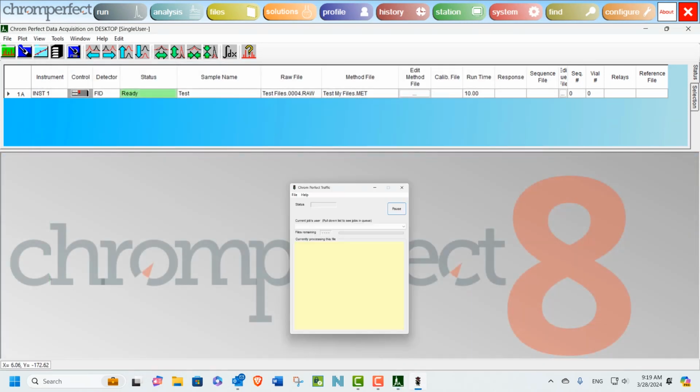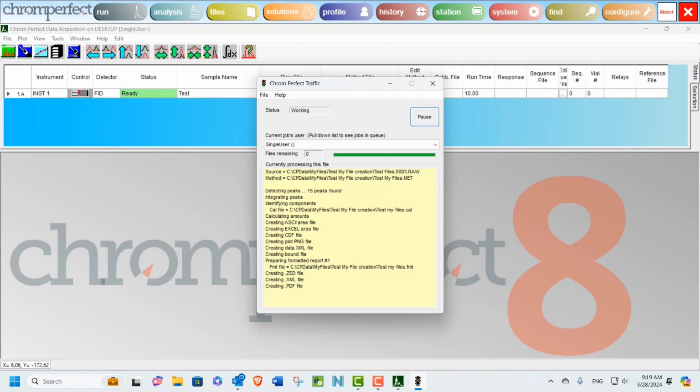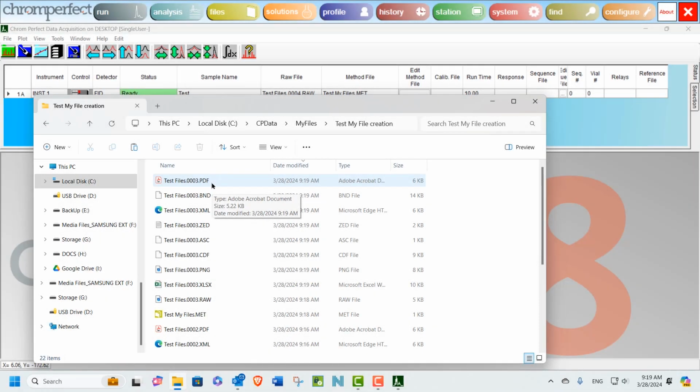Again, at the end of the run, we're going to quickly click on the traffic icon when it appears. So by setting up search directories within the profile editor, we have successfully created all our files, even without the reference to the path within the method file. And here we have the files in our target directory.